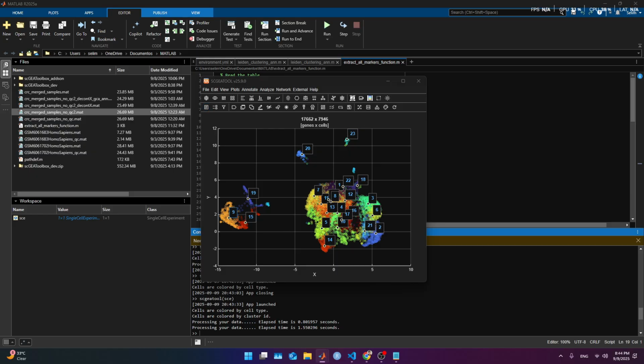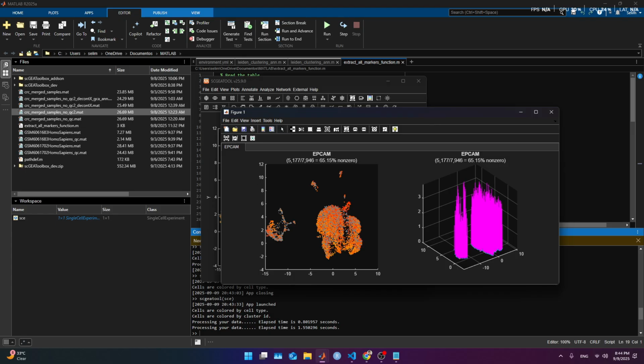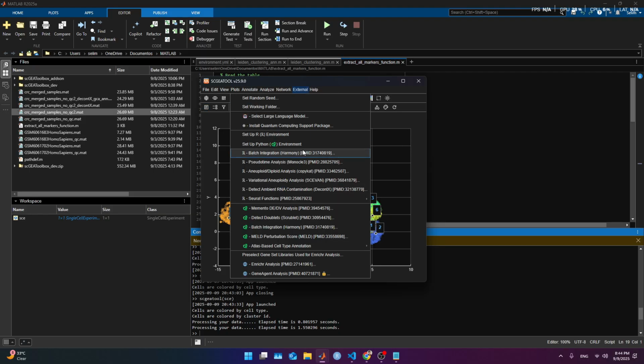But if that's so, we shouldn't have that many fibroblasts in here. We should have only absorptive stem cells, progenitor cells, goblet cells, and everything is pointing to that. So what we're gonna do is click on external, and at this point, we should have the R environment set up and run detect and remove contamination.